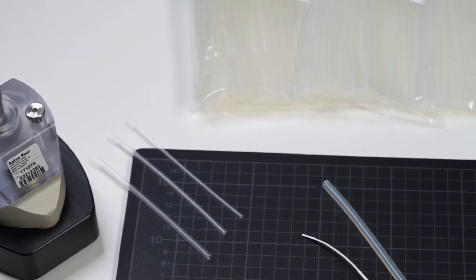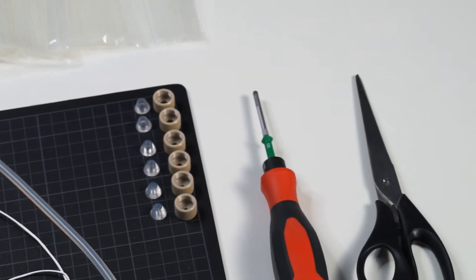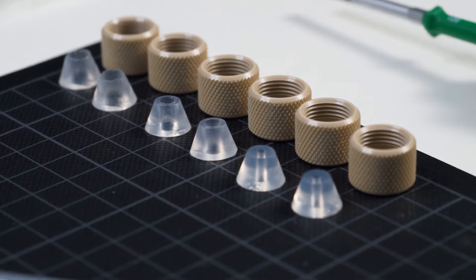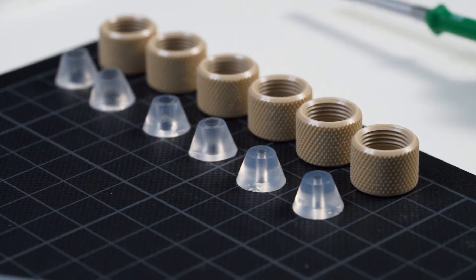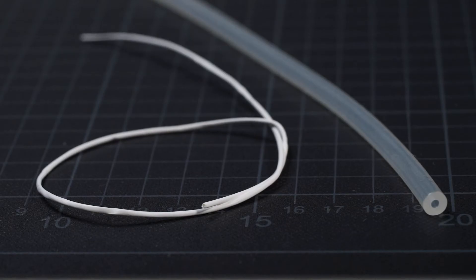Together with this measuring cell you find a series of accessories for sample mounting. These accessories comprise caps and gaskets for sample mounting and heat shrink tubes for embedding porous samples such as hollow fiber membranes.